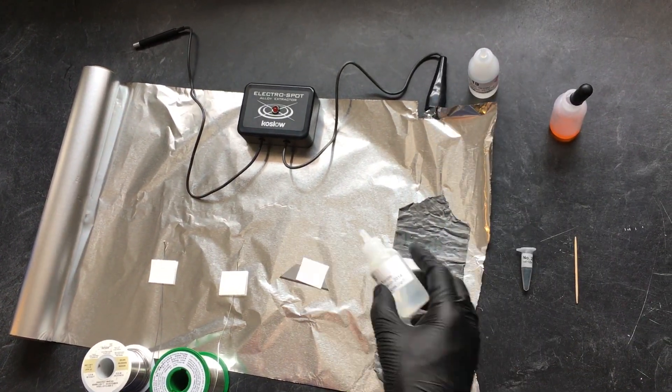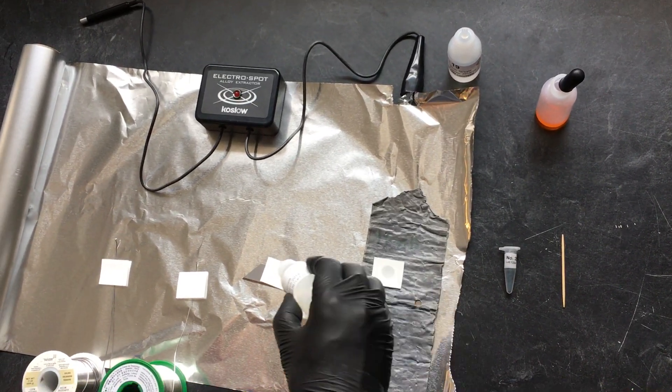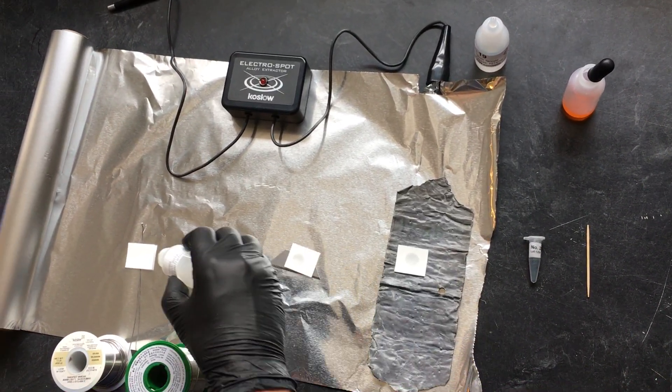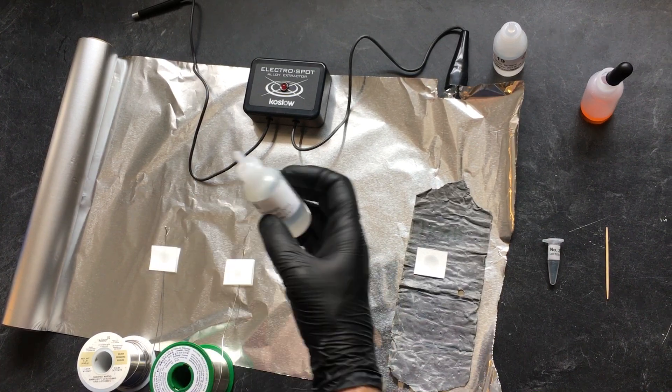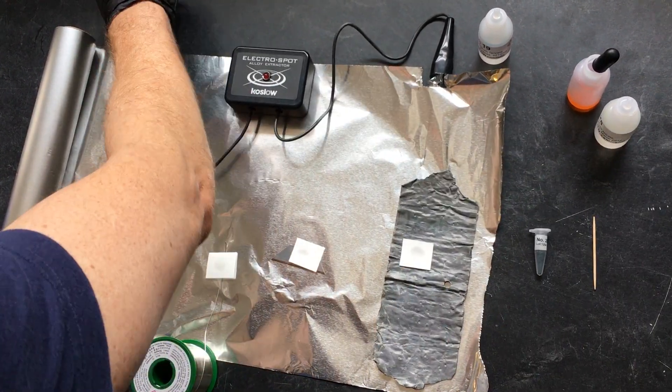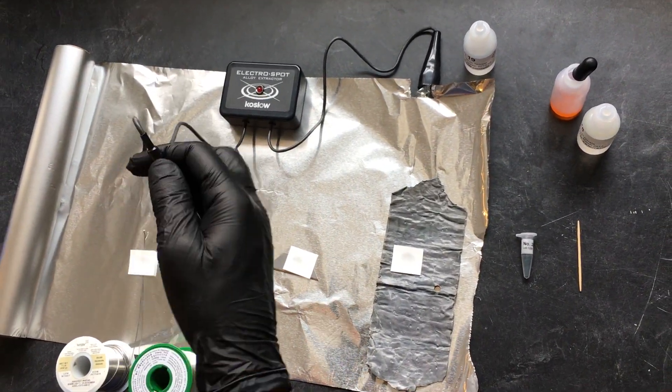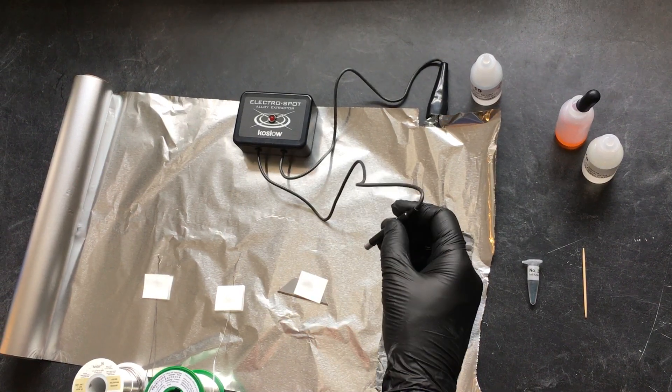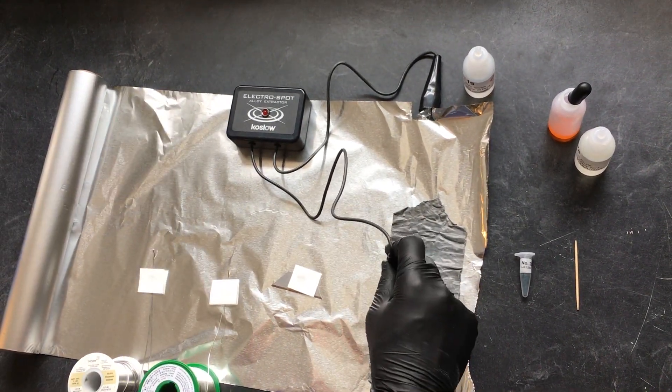Next step is one drop of Solution 28. Then the electro spot process, and all that's really needed is about one second. You'll notice that the red light goes on.